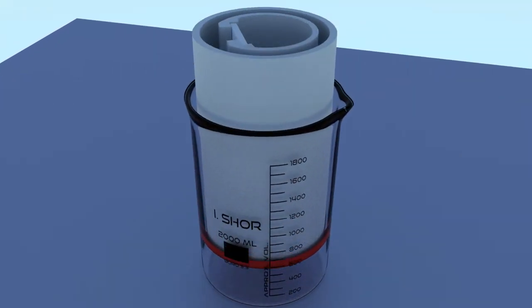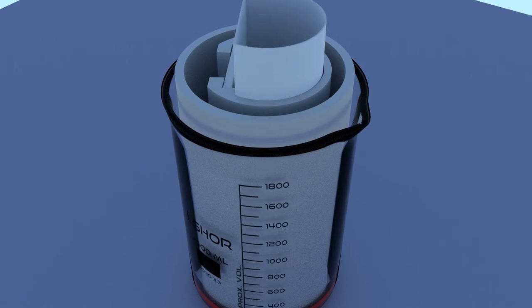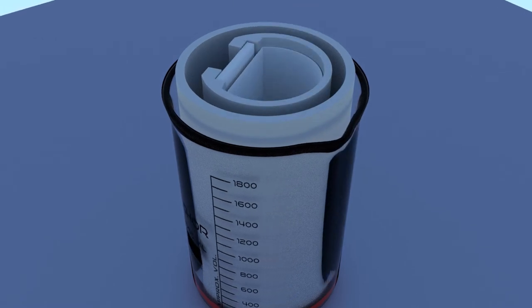Core. Filter pouch. Spin bar base. Spin bar.